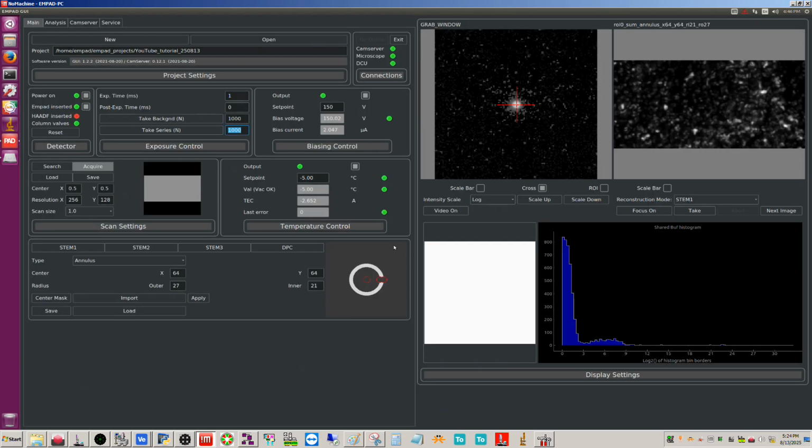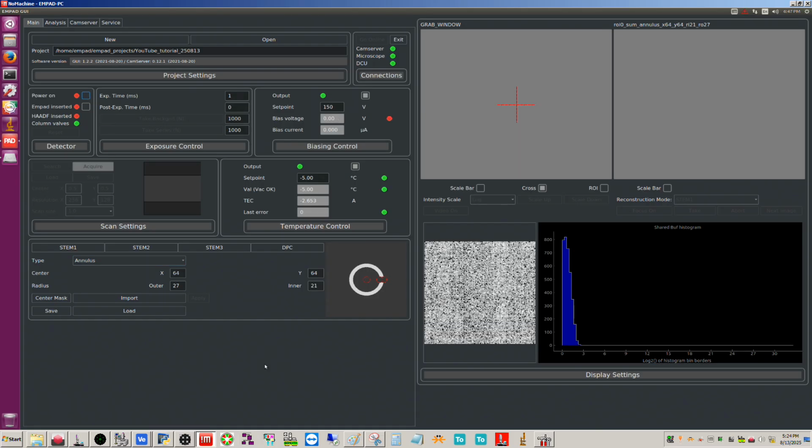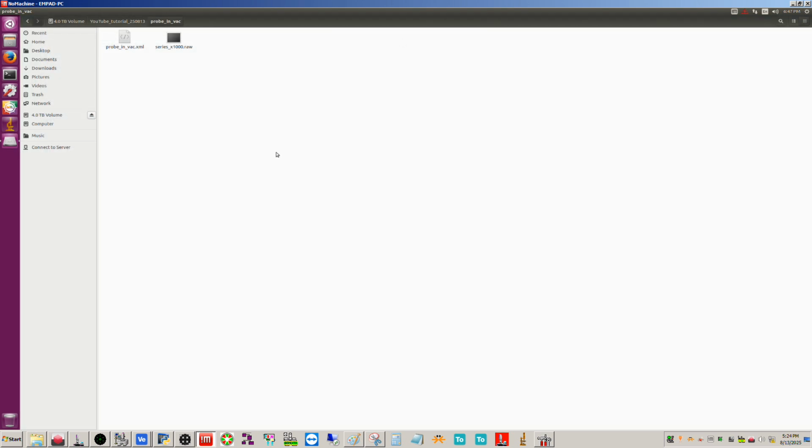So with that being said, we covered now the take series, the flipping of the DP, and that should be everything now with this. So this went a little bit more smoothly this time. Okay, so when we're done with the EMPAD, I'm going to go ahead and retract it, obviously. And we're going to go ahead and click power on to turn off the power. And then we're going to click exit.